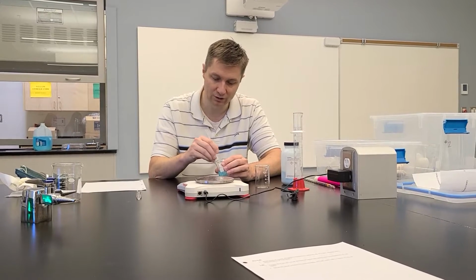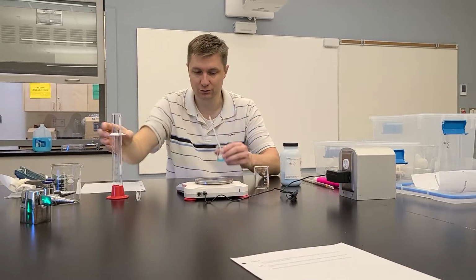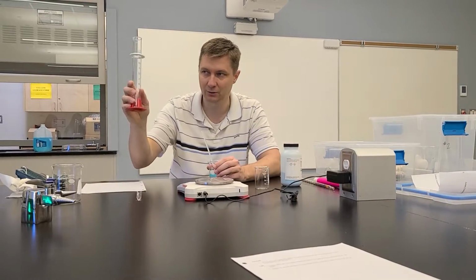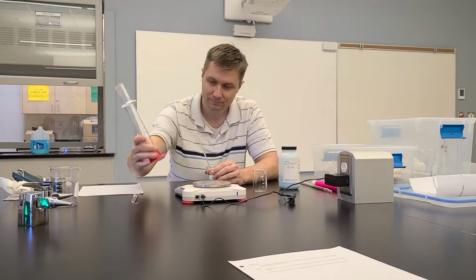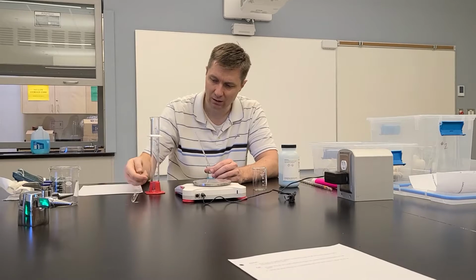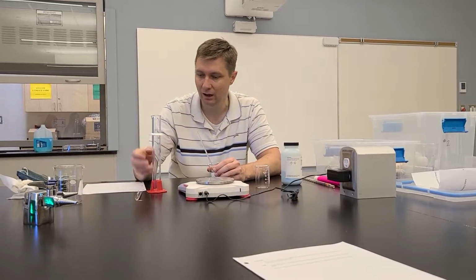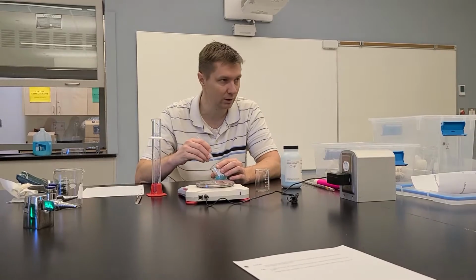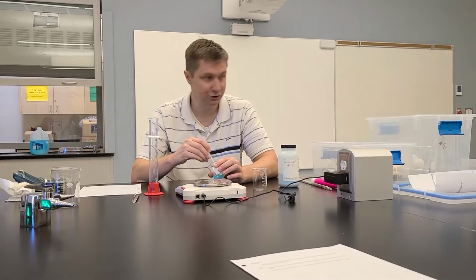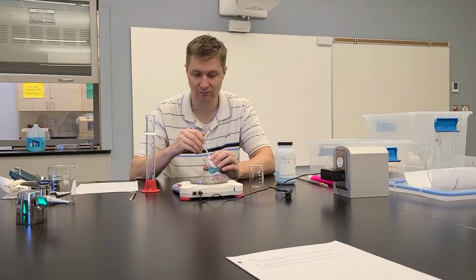And then once the crystals are dissolved, I want to pour the solution that I have in here into this graduated cylinder, and this is very accurate at measuring volumes, okay? So I'll pour this in, it'll be somewhere below the 20 line, and then ever so carefully, I'm going to pour water in here to bring this up to the 20 milliliter line. And that will be my stock solution. It'll be my 20 mL with the concentration at 1 mole per liter, because I would have put in the correct number of grams of copper(II) sulfate for that, okay?